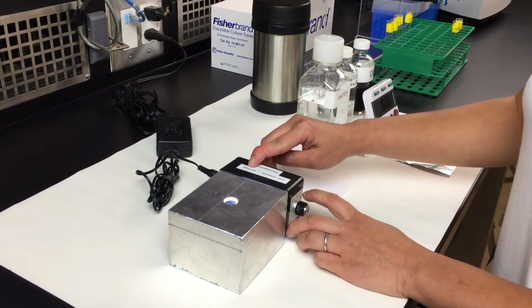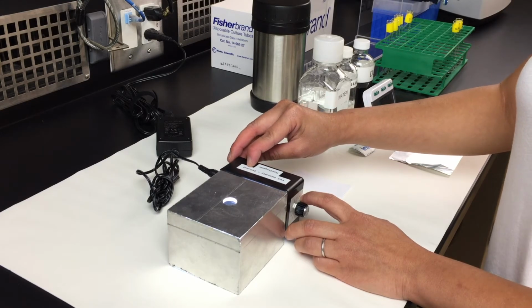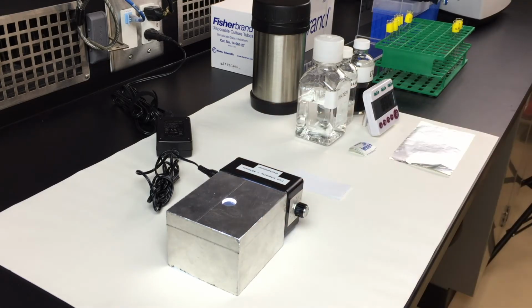On the top of the light source, there will be a full intensity of each light source itself. For example, for this one, it is 457. Record this number down into table 1 in your lab manual. From this moment on, that would be your full light intensity at 100%. From there, you can mathematically calculate the rest of the light intensity accordingly. And you can fill out table 1.